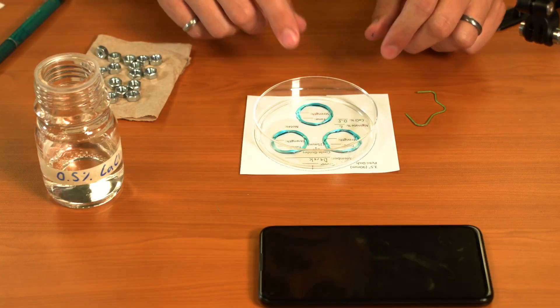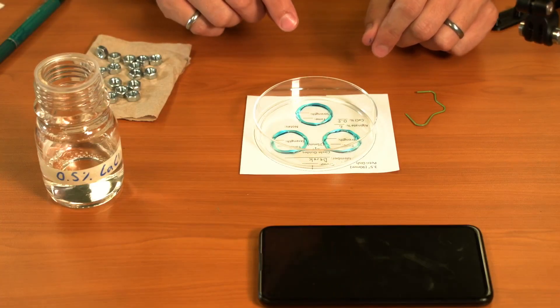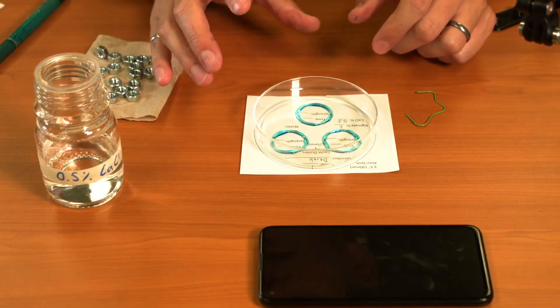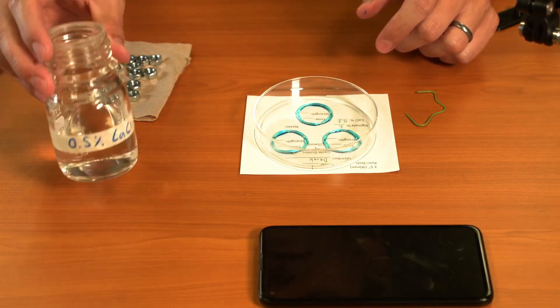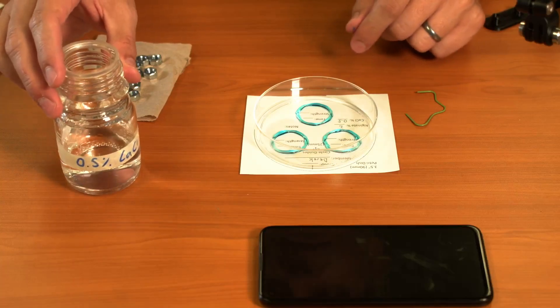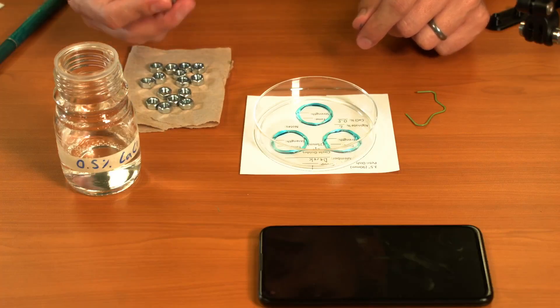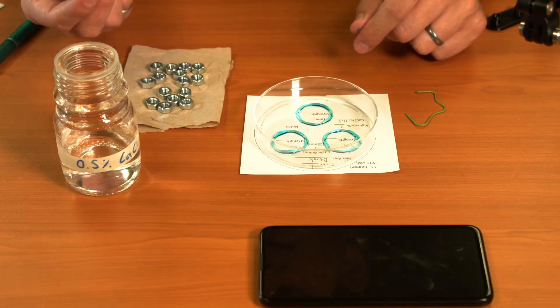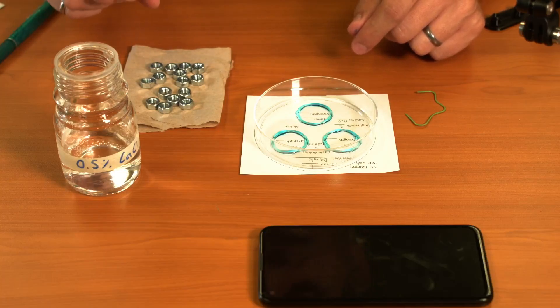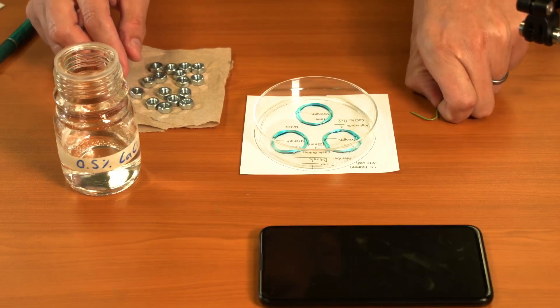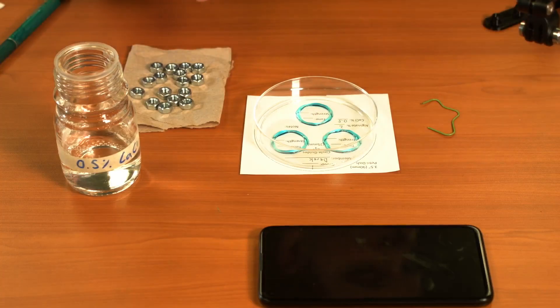What I'm going to do is cross link these rings and time how long they're in the calcium chloride. Then I'm going to measure the strength by putting some weights. In this case, I've got nuts, but washers or any kind of reasonably light rings that you can stack onto my paper clips here will work just fine.